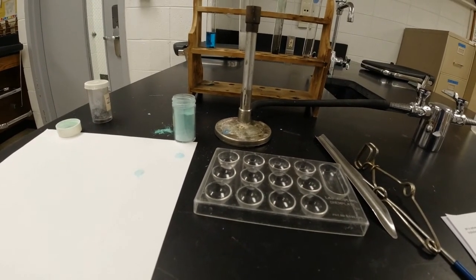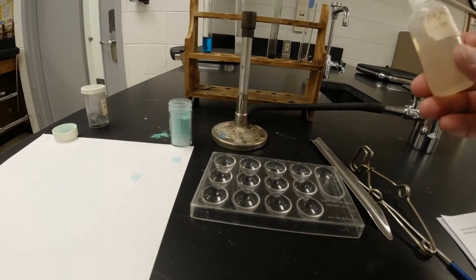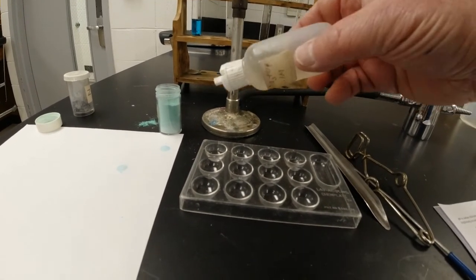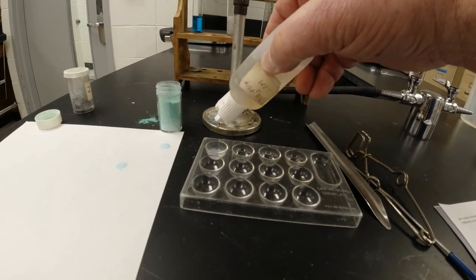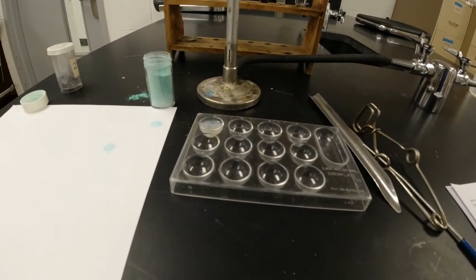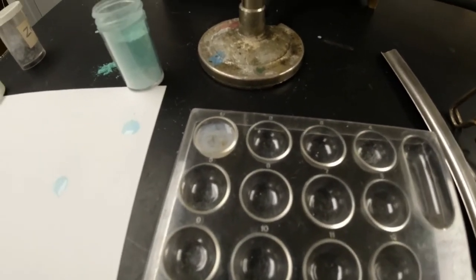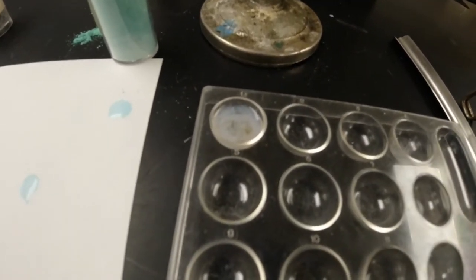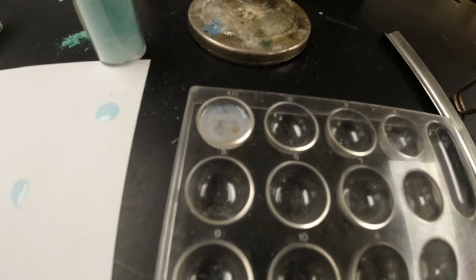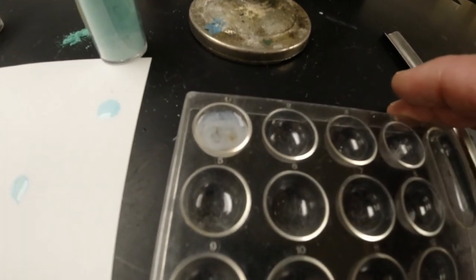And then I'm going to put 10 drops of sodium phosphate. So there's sodium phosphate. I'm going to put that in the same one. I put in 1, 2, 3, 4, 5, 6, 7, 8, 9, 10. And that was a clear solution, but you can see that it produced a white solid. There's a white insoluble solid. In chemistry, we call that a precipitate that occurred, and so we got a reaction there.